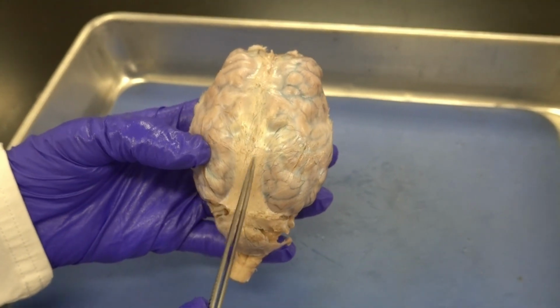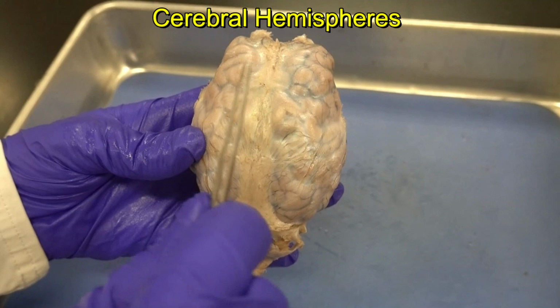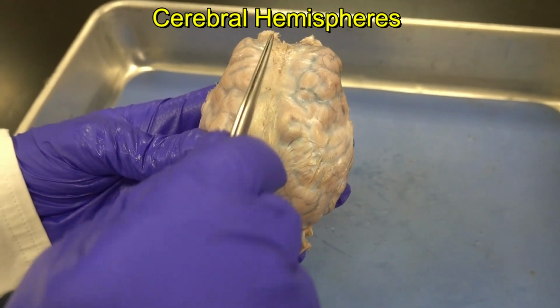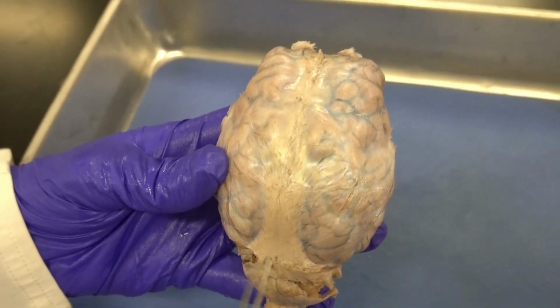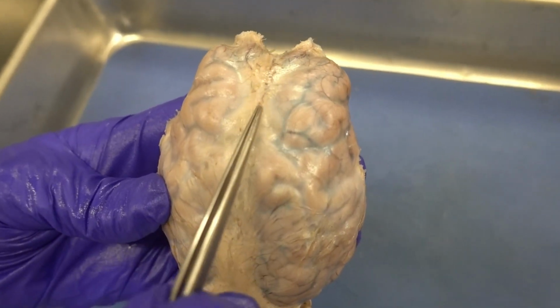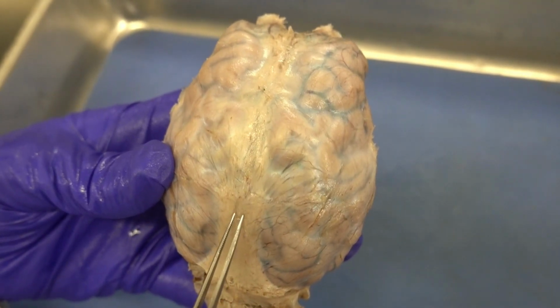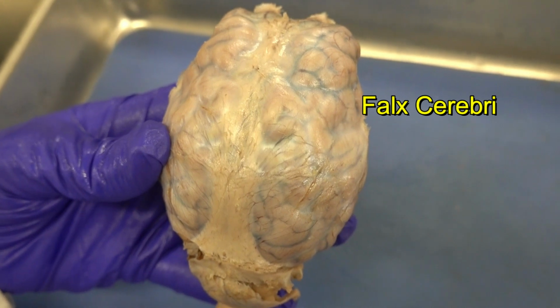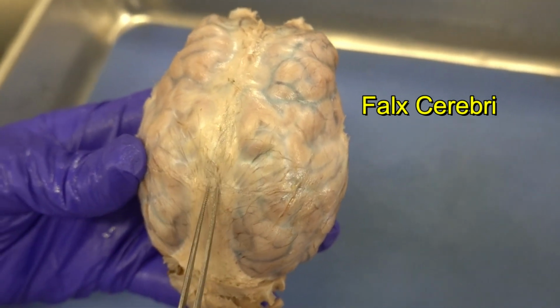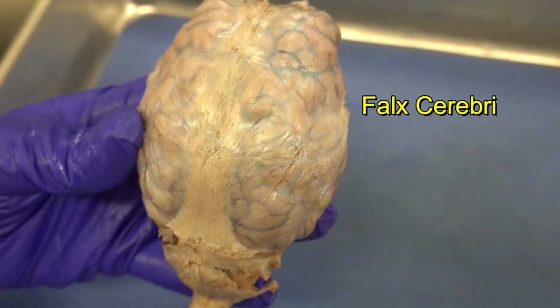Next, the major part of the brain, I can see the two cerebral hemispheres. And between the two cerebral hemispheres, we have a fissure, a deep groove. Right now, that deep groove is completely filled with a very thick layer of dura mater. We name that layer falx cerebri. So we say falx cerebri is the part of the dura mater that separates the two cerebral hemispheres.